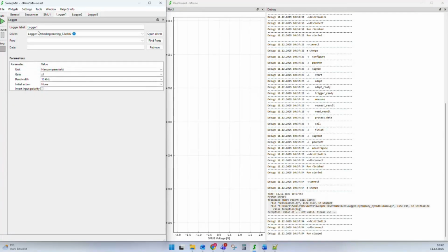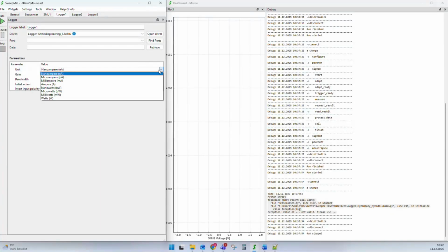Let's go to this Artifex Engineering driver. And I think there was an action. I think it was this driver. I'm not sure anymore. No, it was a different driver. Yeah, no, it was this driver.